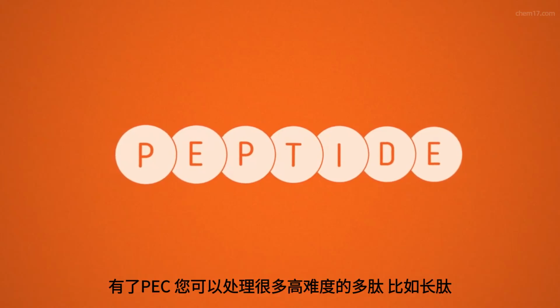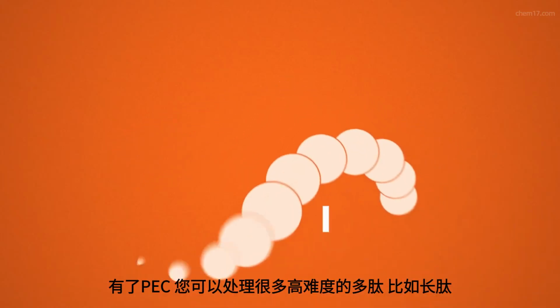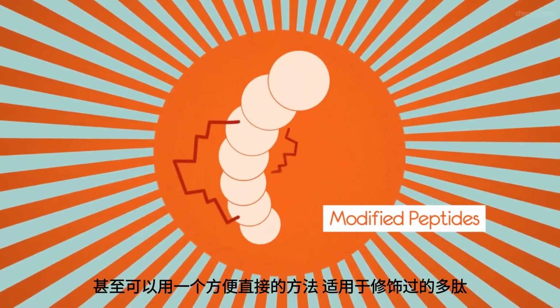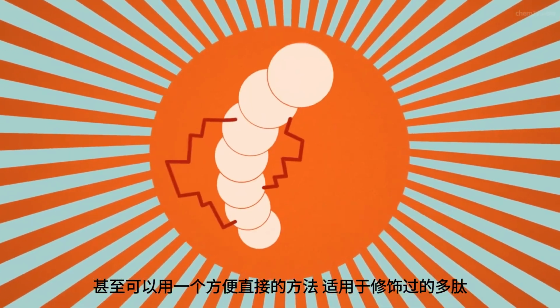With PEC, you can tackle a wide range of difficult peptides, such as long peptides, hydrophobic or aggregating peptides, and even modified peptides with a convenient and straightforward protocol.